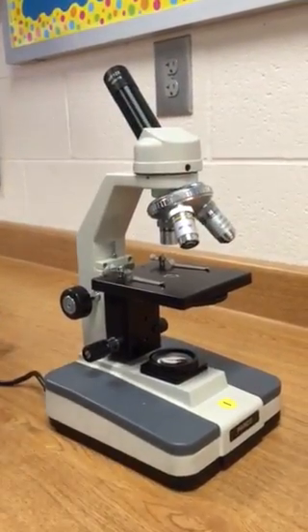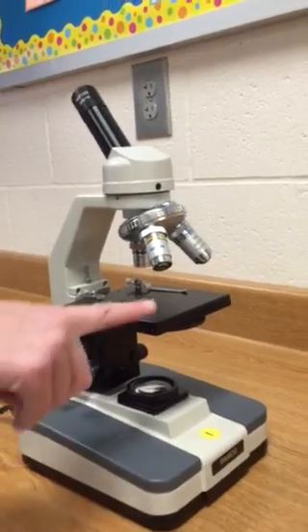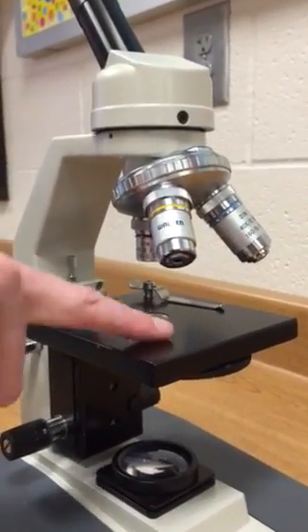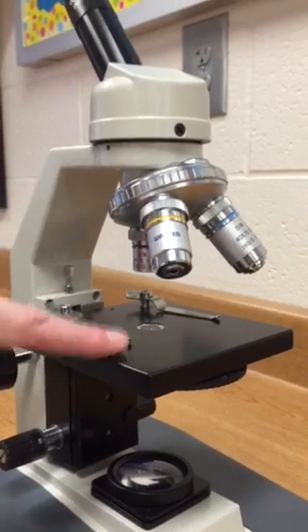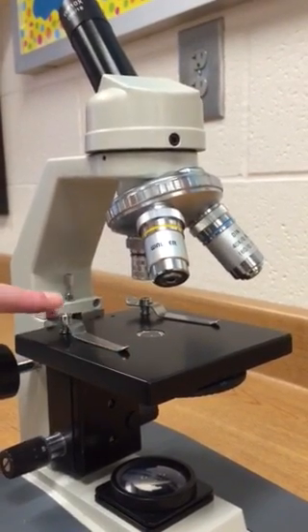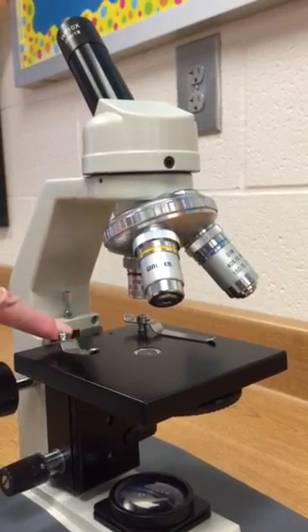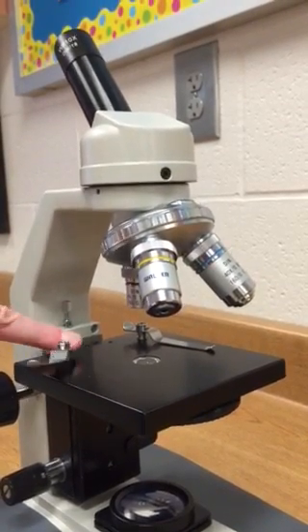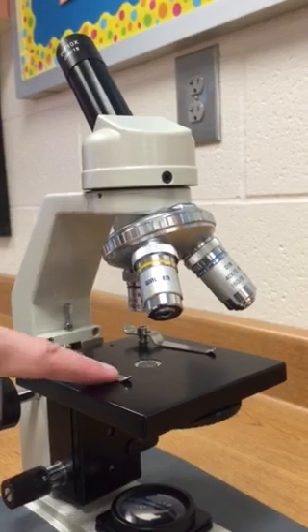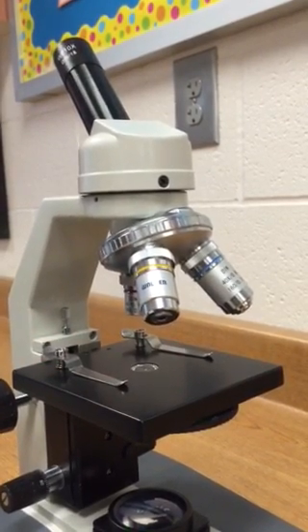Another part of the microscope is the stage. This is not where we dance, but it is where we place our slide. Here we have the stage clips — if you push them in the back you can move them right to left. This holds your slide in place so the specimen doesn't move around.